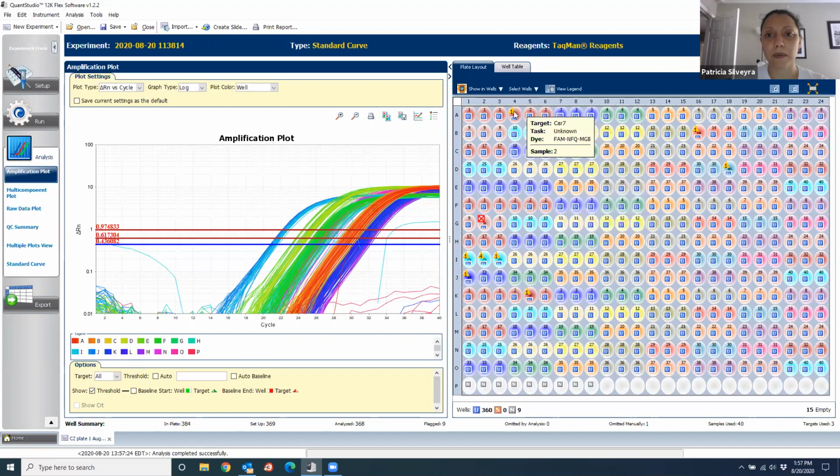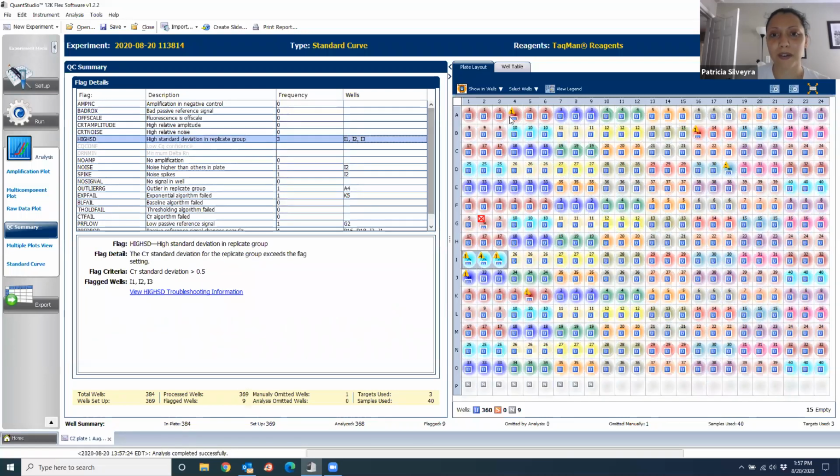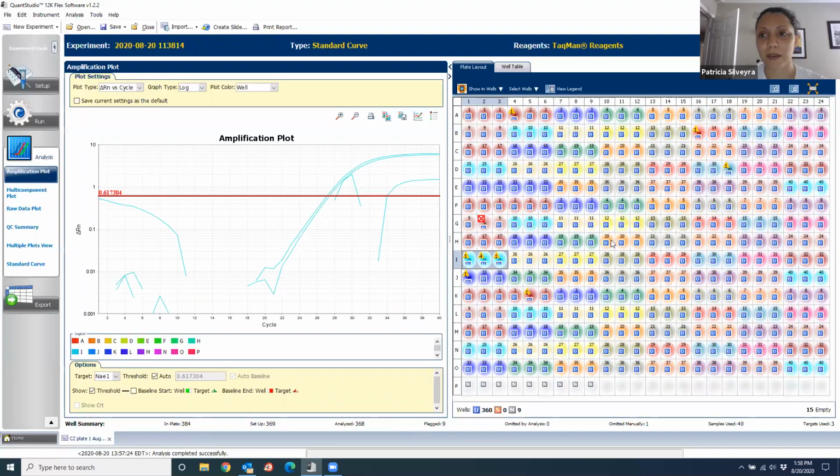So I'm going to go one by one, and usually you see the little triangle over here, a yellow triangle. It shows up on top of all the ones that are problematic. So you can either go here to quality control and go to the wells, or you can go one by one and identify them yourself. I prefer to look at them one by one because sometimes the machine identifies an issue, but it's not an issue. It just says, oh yeah, there's this thing that's different, and you look at it and it's not. So let's just look at here.